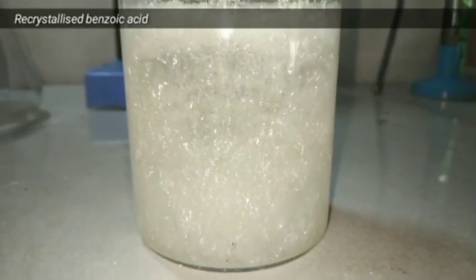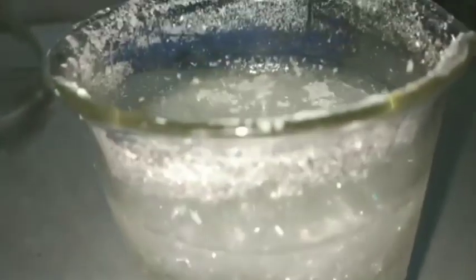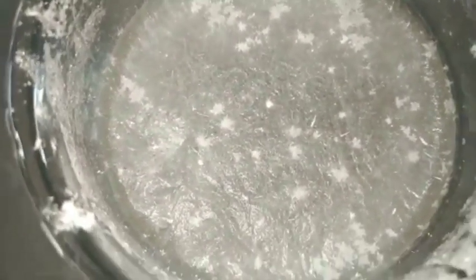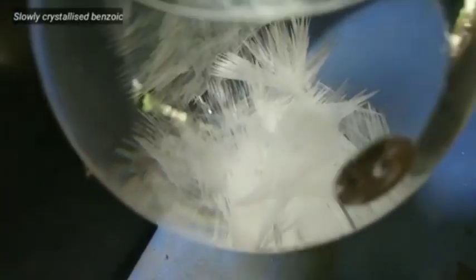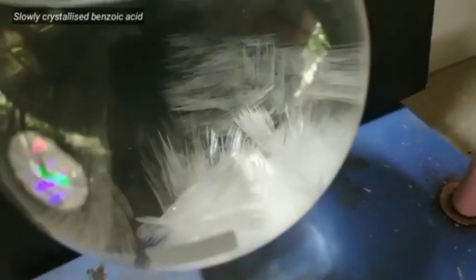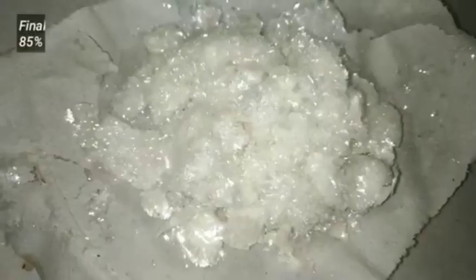The rest of the benzoic acid was dissolved in 250 milliliters of hot boiling water and immediately cooled to crystallize out, as you can see in this beaker. This is the clip showing the needle-shaped crystals of benzoic acid formed on slowly cooling the benzoic acid solution which we had made in the round bottom flask.